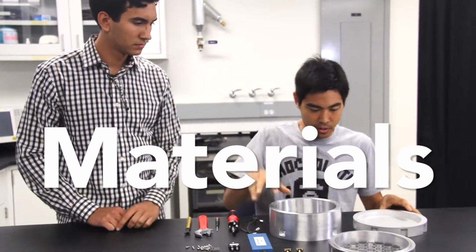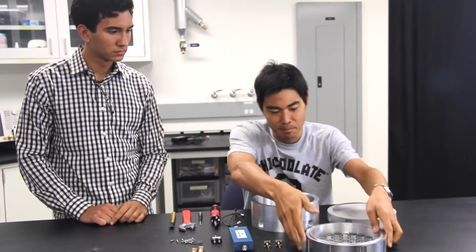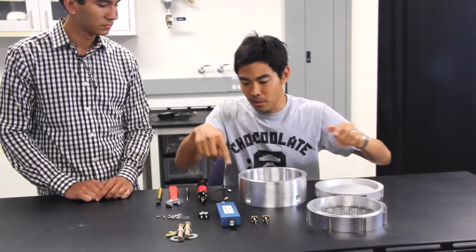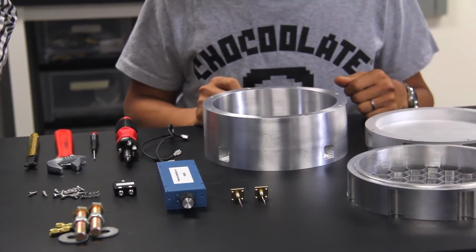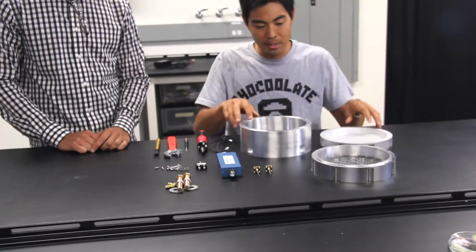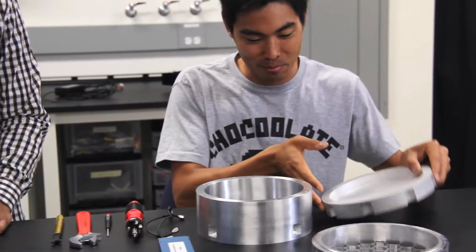I'm assembling the cavities. So this is the cavity, 3 parts. This is the bottom part and middle part, and this is the top layer. So the mouse will come on top, and the rod will go stimulate there. These parts are the phase shifter and power divider. This is the excitation source for the cavity. These parts you can get off the shelf. And for the cavity, you can send the 3D CAD data to this link. Okay, so let's get started making the bottom parts.